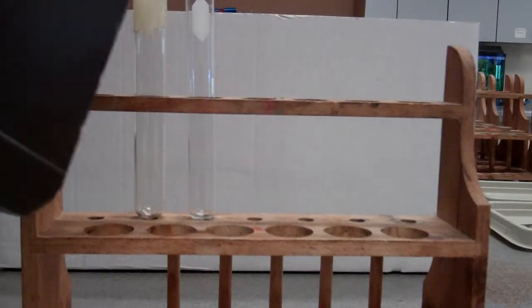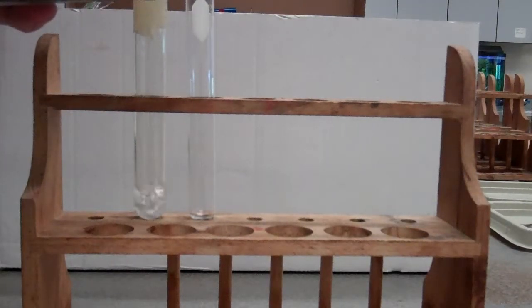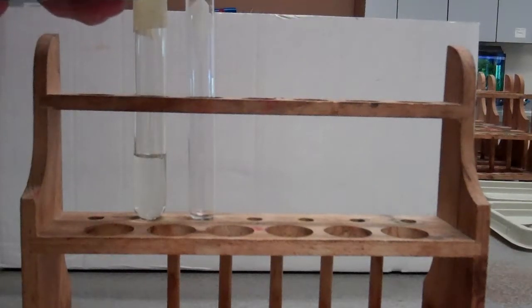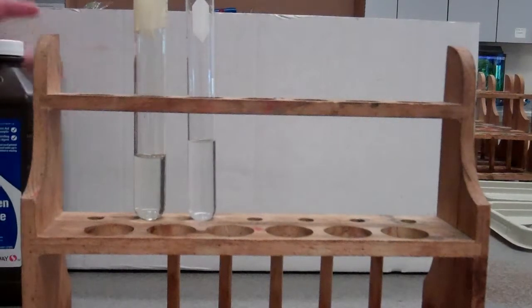All right, so if we go ahead and put some hydrogen peroxide in our test tubes, we're going to look for a couple different reactions here. Remember, hydrogen peroxide is H2O2.